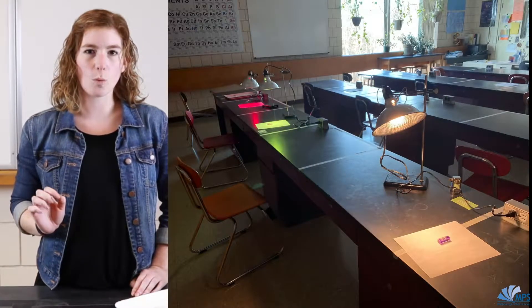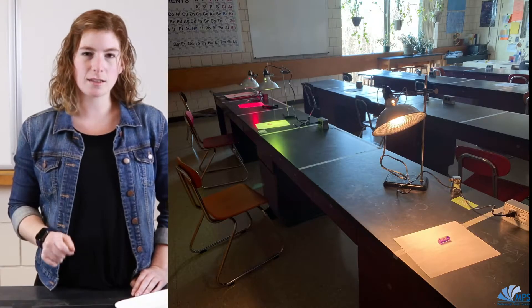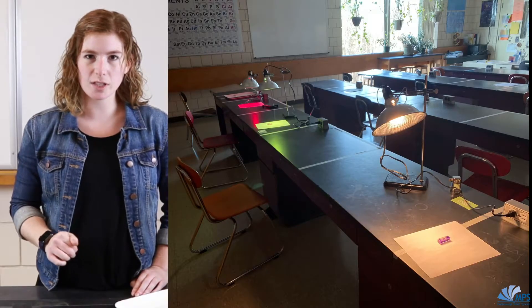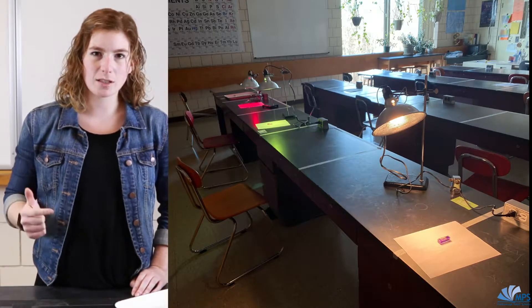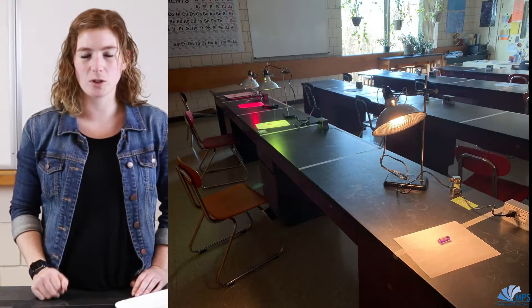We have a couple of different conditions that we put our algae beads under. We have a white light like under a lamp, we have a green light, a red light, I put some in the window for natural sunlight, and then the last sample was wrapped in tin foil to put it essentially in as much dark as possible.